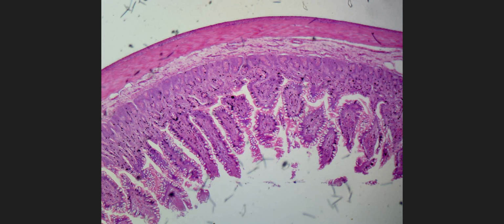So the small intestine is mainly responsible for absorbing nutrients, and the histology does reflect this. Throughout the small intestine we have numerous folds into the lumen, and we can see that pattern really nicely on the slide. I just pulled this from Google, and you can do the same as you're studying. These are circular folds called plicae circularis. All these do is help slow down the passage of material through the small intestine, as well as increase surface area for absorption.